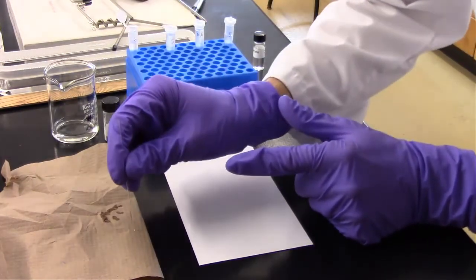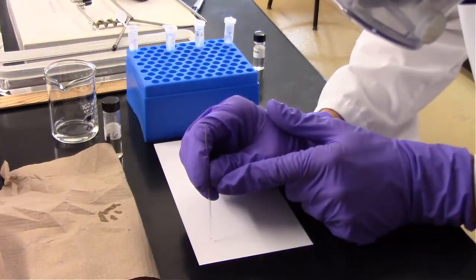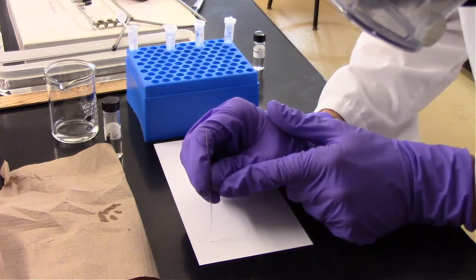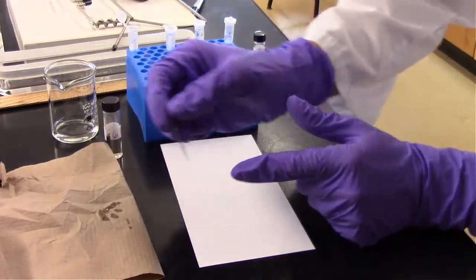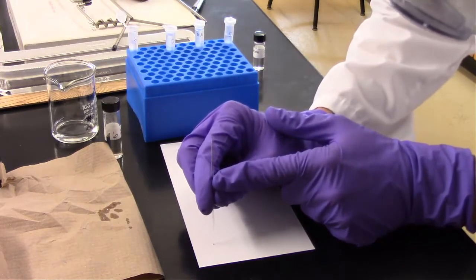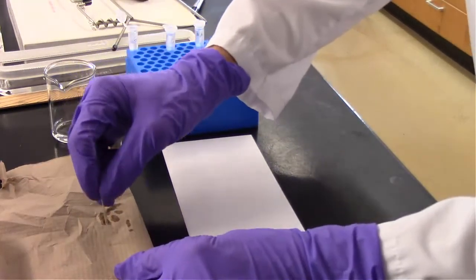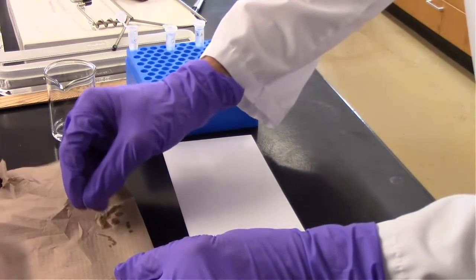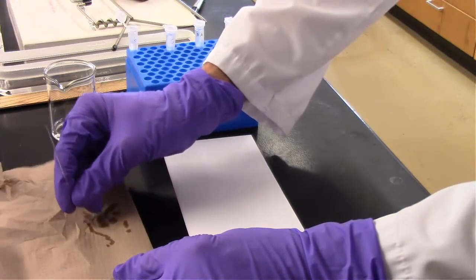My first mark. It's a little bit different than what you've seen in the organic lab because this is an aqueous solution. So it's hard to get a small spot. I think that works. But you really have to press it on the plate and then it all just wants to come out of the plate, or out of the spotter.